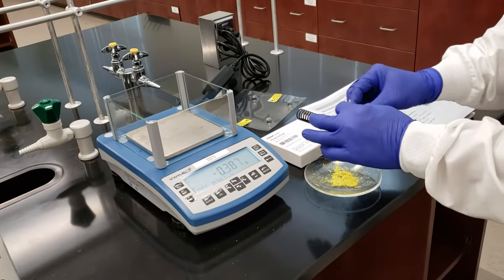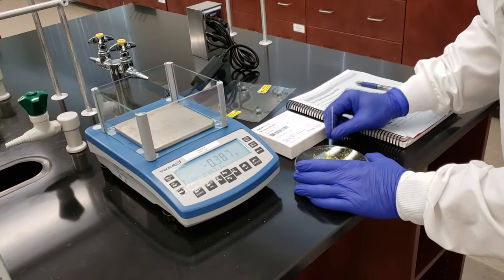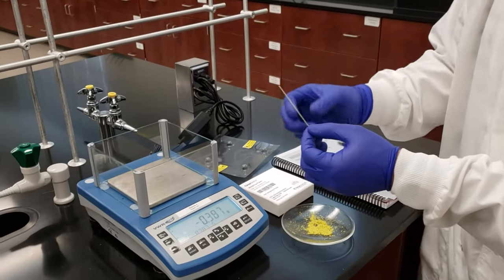Just get a little bit more here and then we'll be all set and ready to go. And that should be plenty to get our melting point right there.